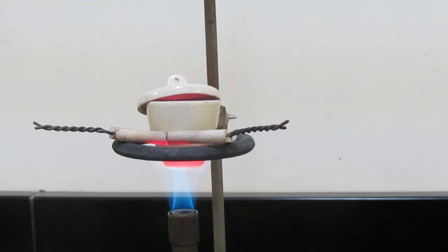After this is heated, what we will do is we'll allow it to cool for about three minutes. We'll grind the contents in the crucible into small particles with the stirring rod I'll provide for you. We'll rinse the particles off the stirring rod with a small amount of distilled water, and we'll replace the cover and allow it to heat. Now what this is going to do is allow the water to react with any of the nitrides that may have formed with the magnesium. We only want oxygen forming with the magnesium.